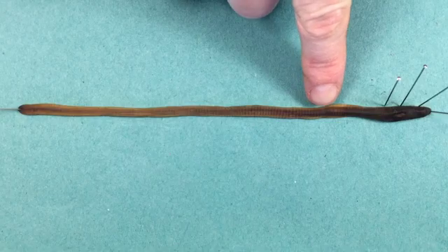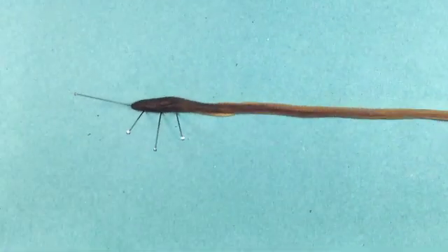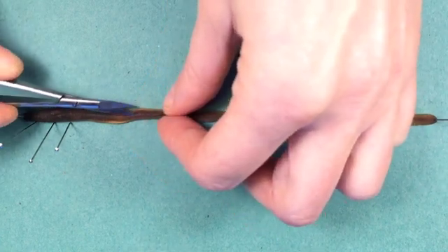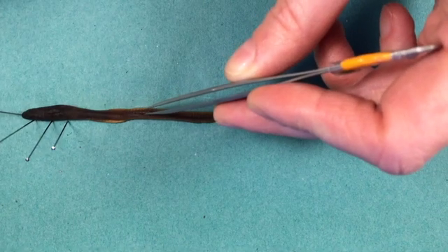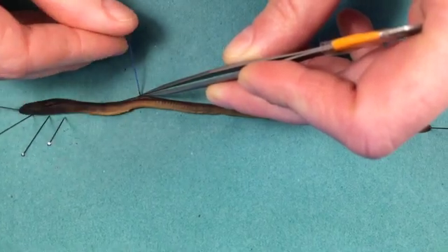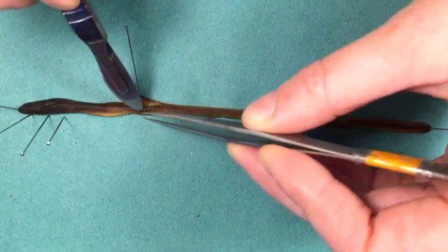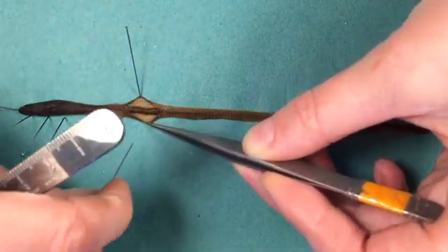To get a feel for the dissection, I'm going to start by opening up the posterior part of the worm. I'm turning the worm around because I'm right-handed and work right to left. I need to make a small incision just posterior to the clitellum to get my scissors in, cutting very shallowly and extending the cut to about 2cm long. Then I want to pin one side of the worm — drawing the skin back and pinning it down — and then cut the septa that's holding the worm with a scalpel.